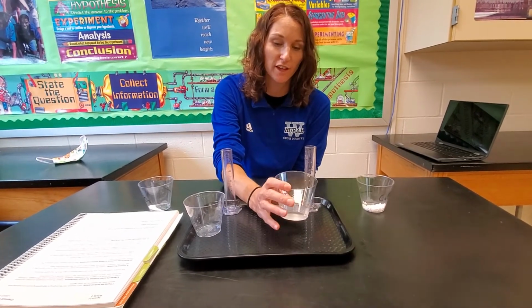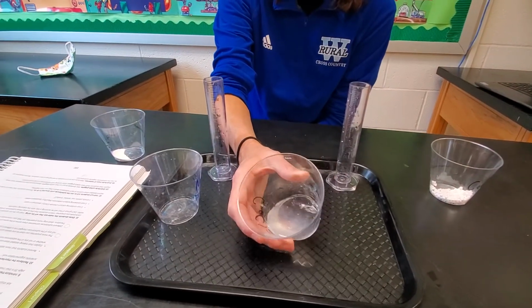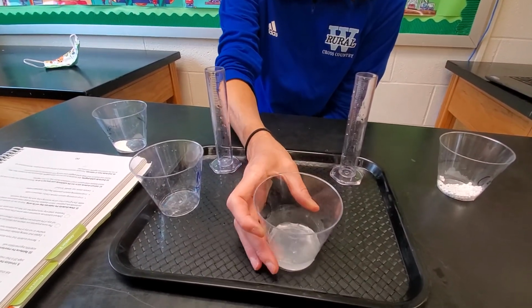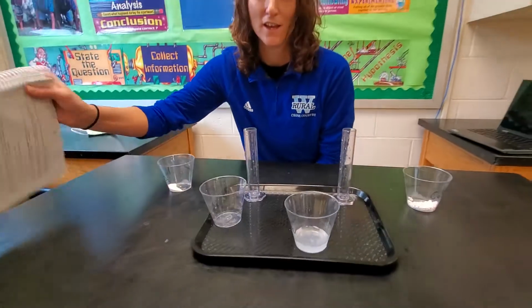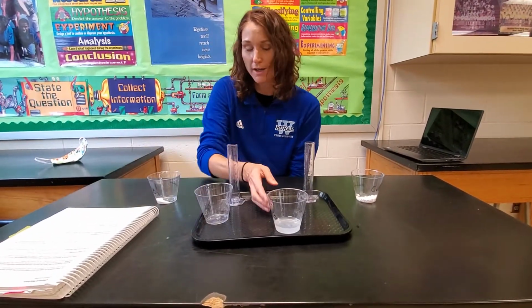It almost looks gel-like even as well. Instead of liquid water, it kind of has that gel-like appearance to it. So something did happen in this reaction. So now you need to look closely and figure out what might have taken place, and you'll do that in the simulation following slide 11.